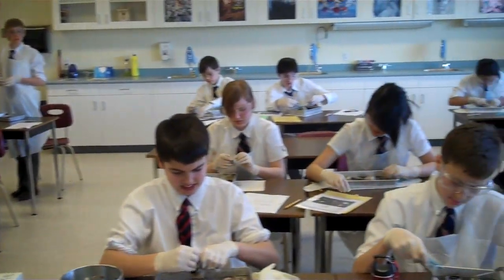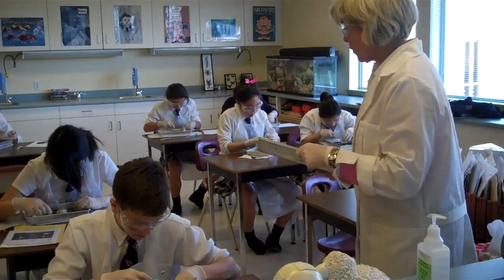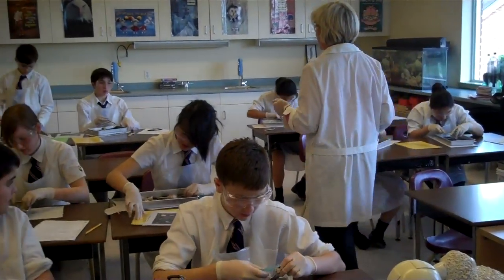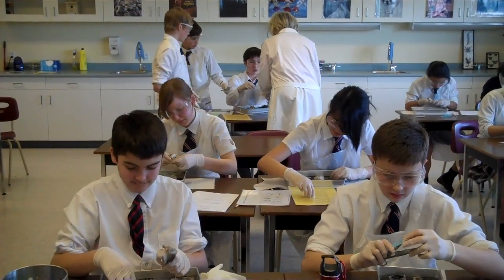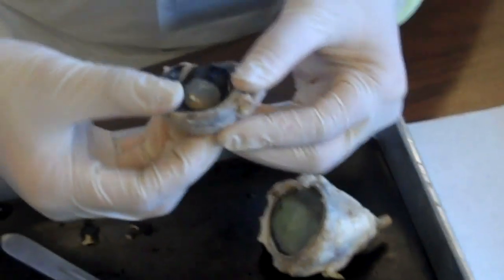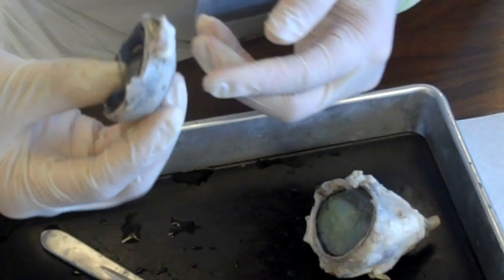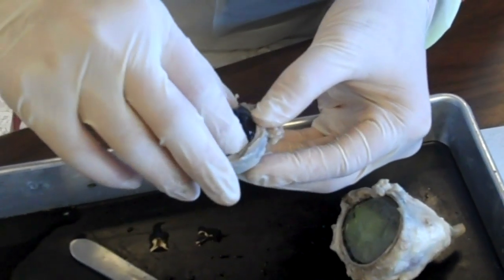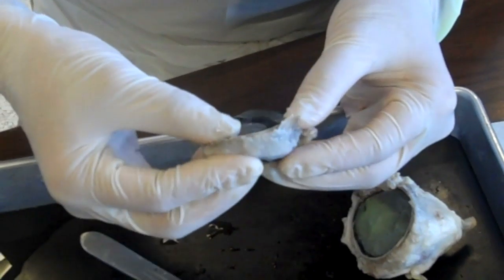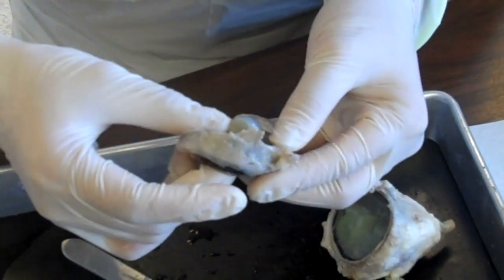All you need to do is get rid of the tissue. Please give me the scalpel. Your scissors. Is that the lens? That's your lens! You can pop that right out — push up or through. See how that vitreous humor just kind of holds the lens. It holds your retina and everything in place.